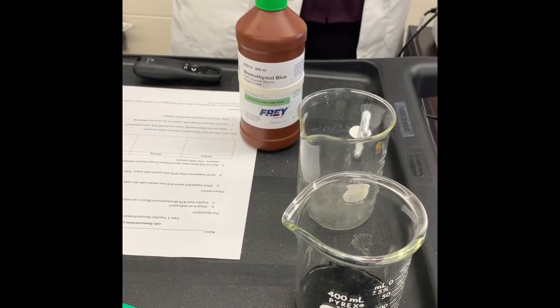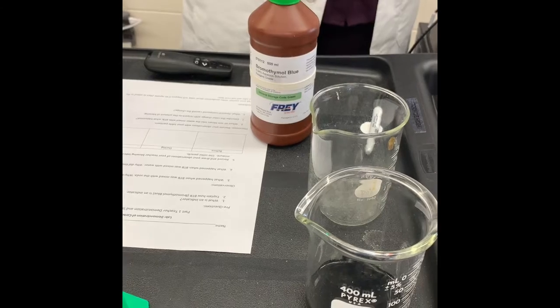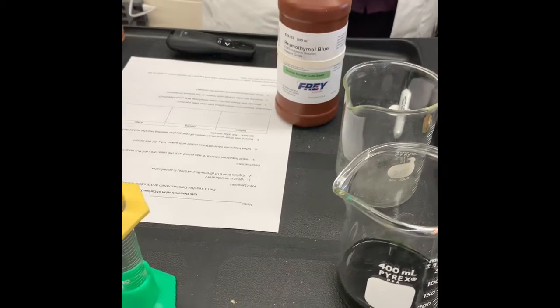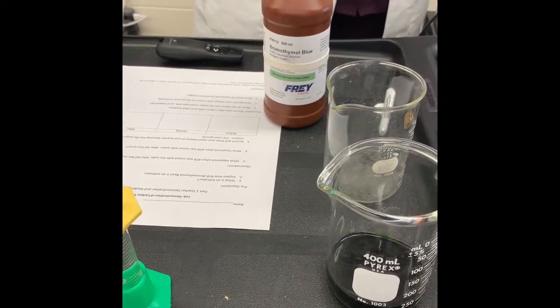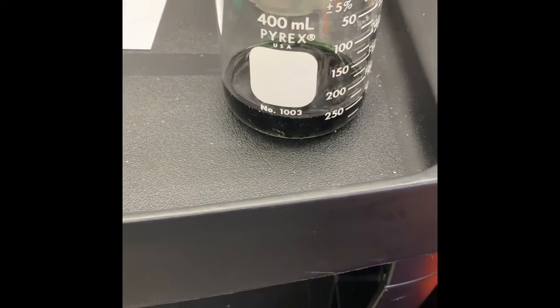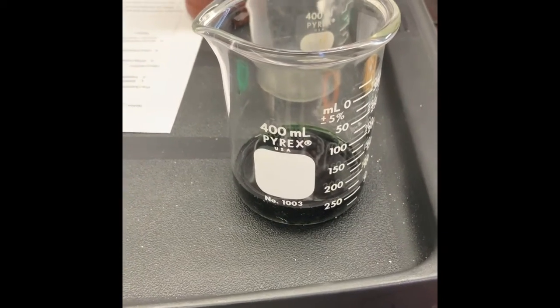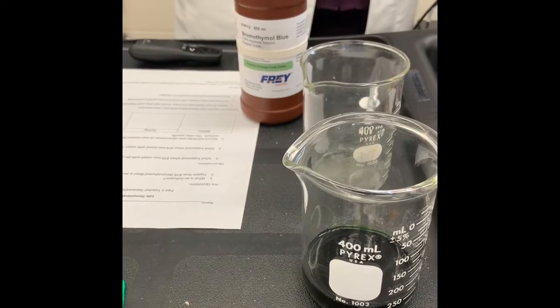When we were studying our macromolecules, we saw Benedict's solution, and we knew that it was an indicator because it tested for simple sugars, such as glucose, and it's a clear blue solution. In the presence of a simple sugar, that blue solution changes color to green, yellow, and even brick red depending upon the amount of sugar. We use Benedict's solution in our cell component and macromolecules labs.